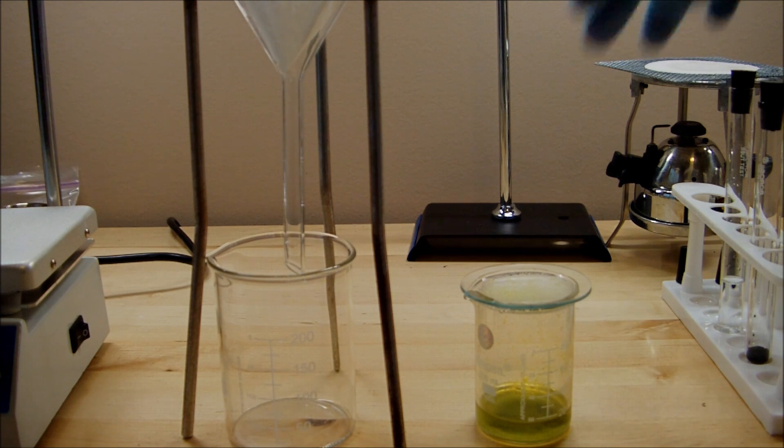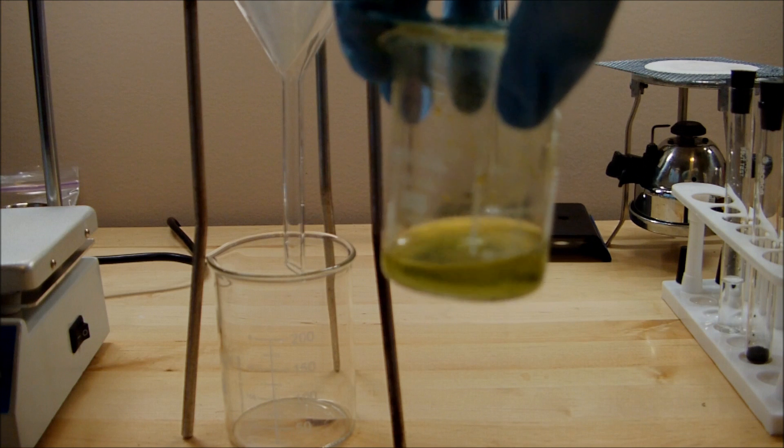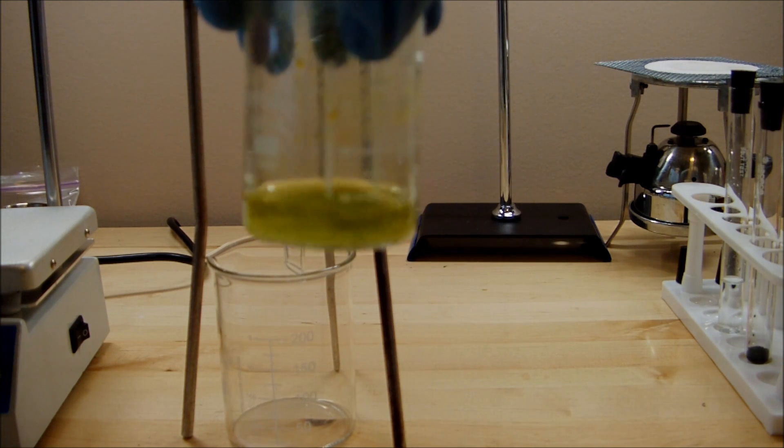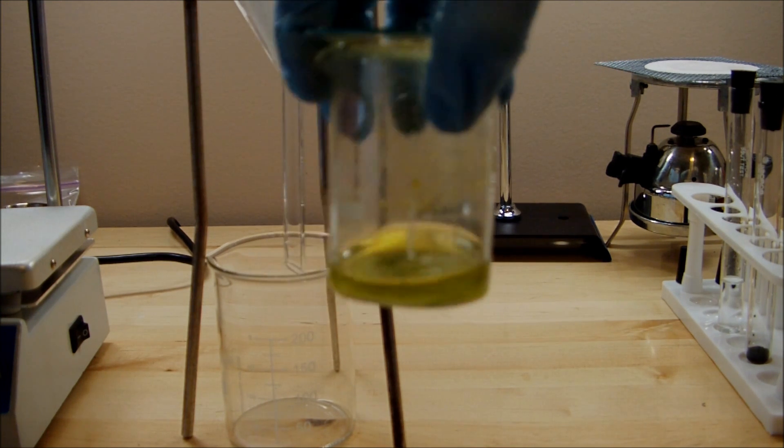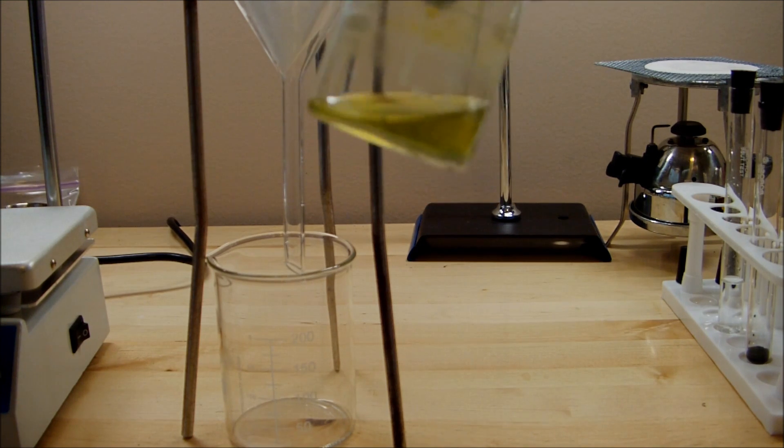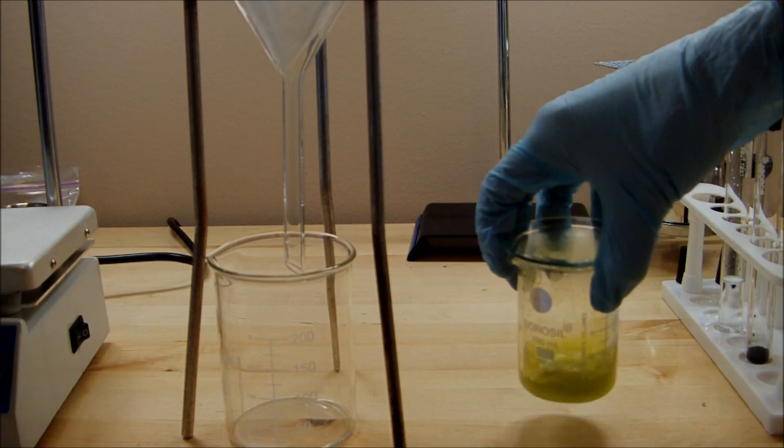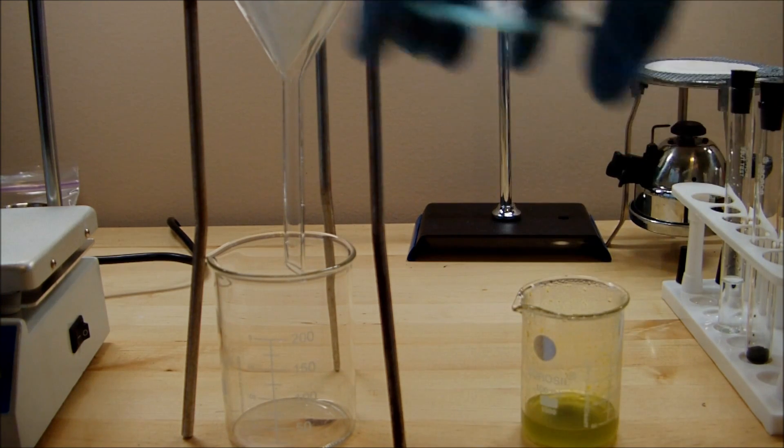I've left the iron and hydrochloric acid mixture to react for a while. And as you can see, it's gotten rid of the majority of the iron wool, and it's turned the solution sort of a lime green color. There's a whole bunch of insoluble material in there, so I'm going to filter that off.